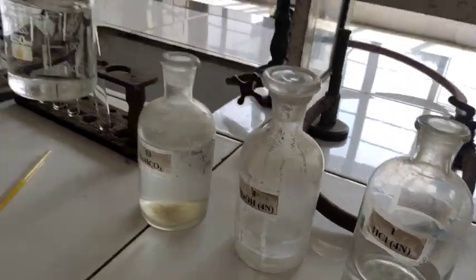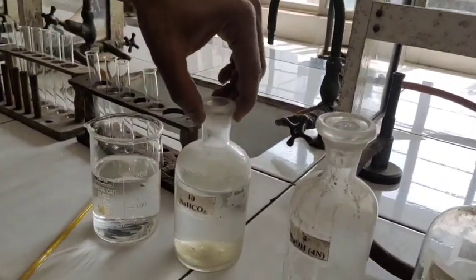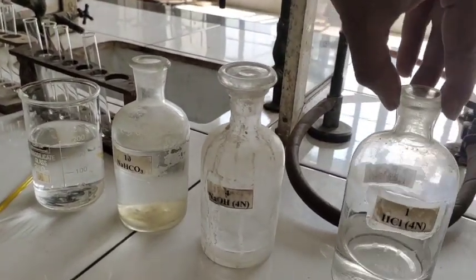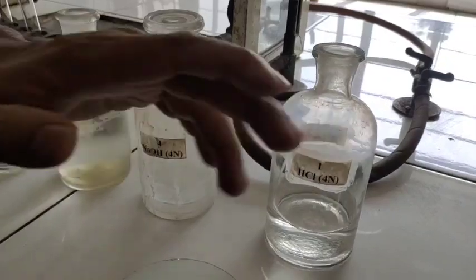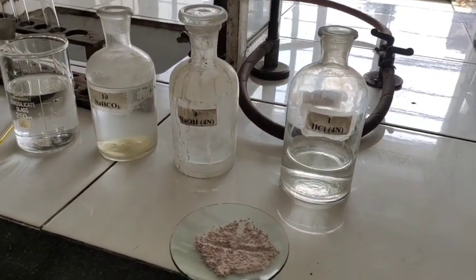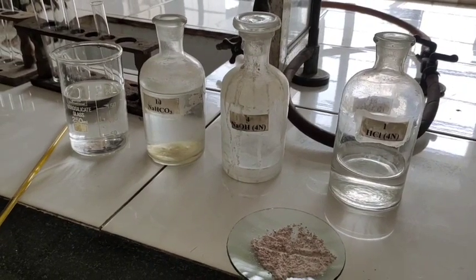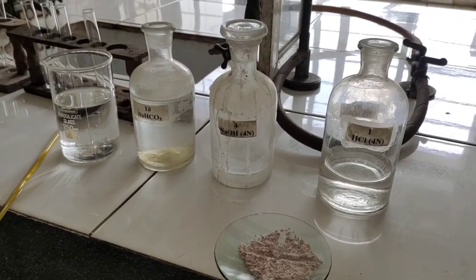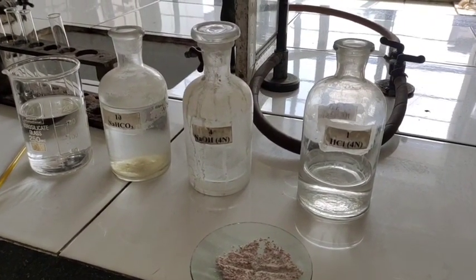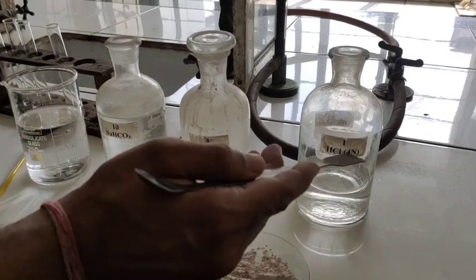What are they? This is water, sodium bicarbonate, sodium hydroxide, and HCl. In the right sequence — see, if someone comes to your place, the first thing which you offer is water. So the right sequence of welcoming the organic molecules is: water, sodium bicarbonate, sodium hydroxide, and HCl.